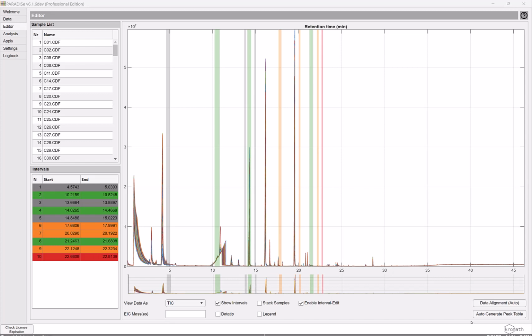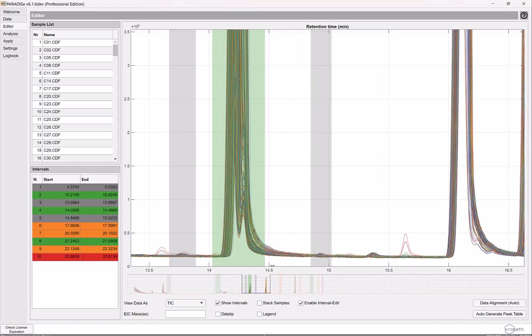I would just like to give you a little example on how we can resolve overlapping peaks. Actually, let me give you a few. I have a session here. I have defined some intervals. They are colored by how well the chemicals found are matched in the NIST database. That's not the issue here. But let me show you this particular peak here.